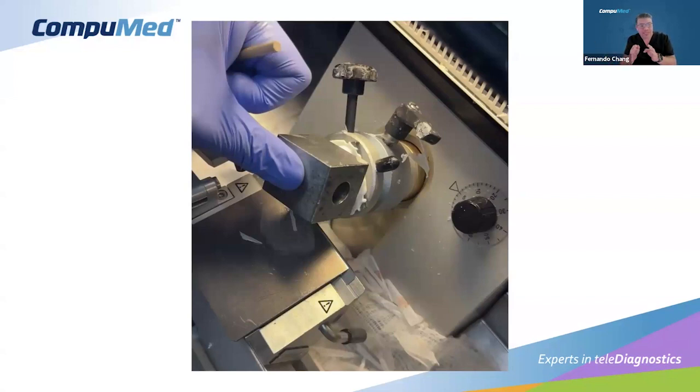So it created a space between the tissue. You'll see, for folks doing kidney biopsies, wedge kidney, wedge livers, sometimes there is a space in between. So we use a technique called plastering. This plastering is just like when you spackle a wall, when you are doing sheetrock. You spackle this and you seal it because we need this handle. We're not going to waste tissue. So right now we're using one of these heat extractors to plaster this and to make sure that the surface where we add this OCT is at the same temperature.